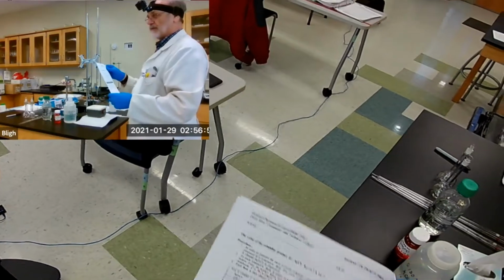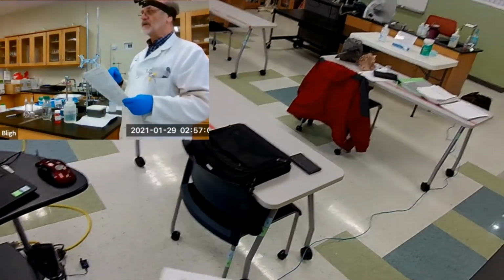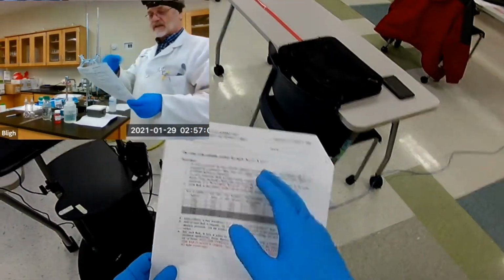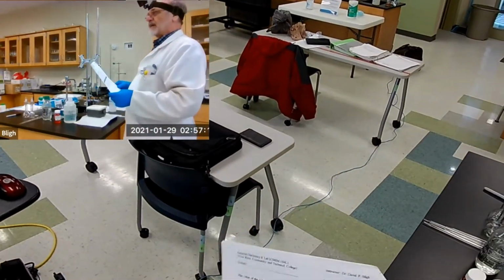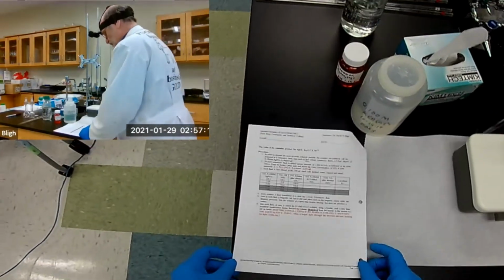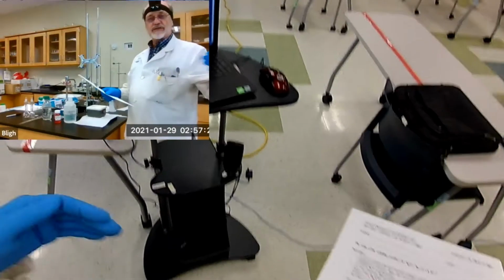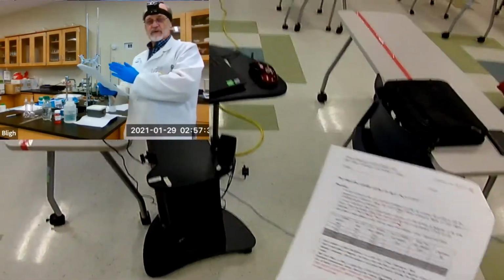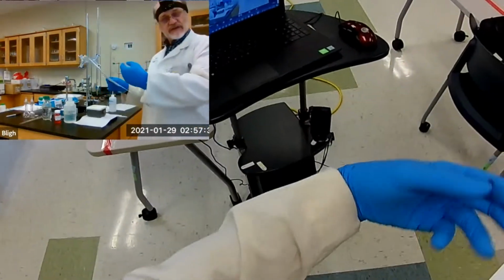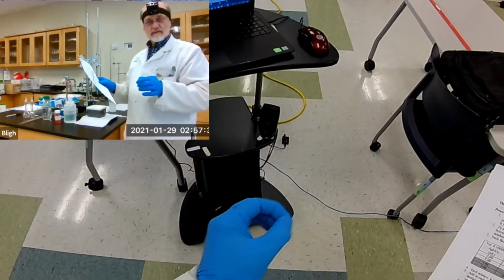I've got on the board over there a table set up to input the information, and then I'll scan it with the head cam so it's easier to see than putting things here on this sheet of paper. It'd be too small to see. All right, so what do we need to do? Well, it's been my experience. Initially, the method was set up for 4 different concentrations of silver against ammonia. And that changes the equilibrium expression for the silver diammonia complex ion.